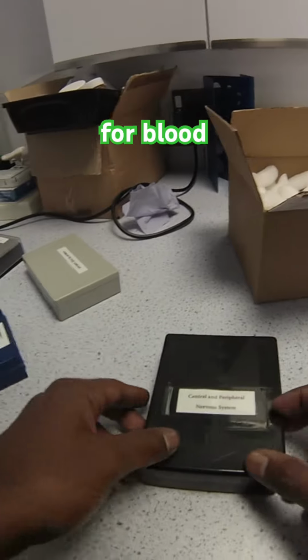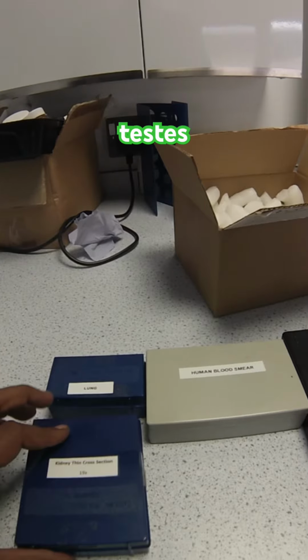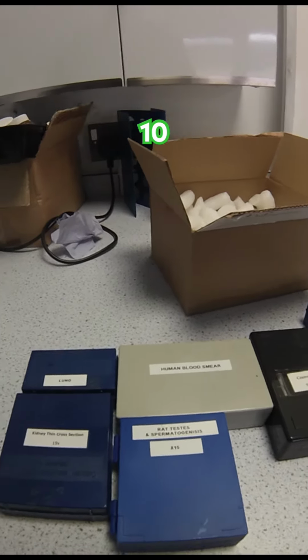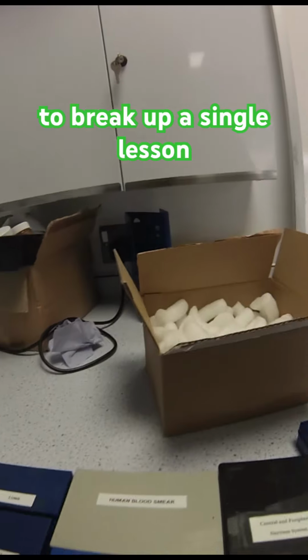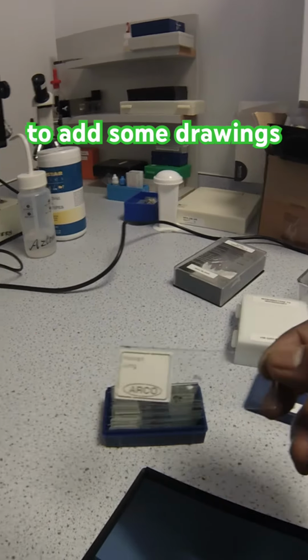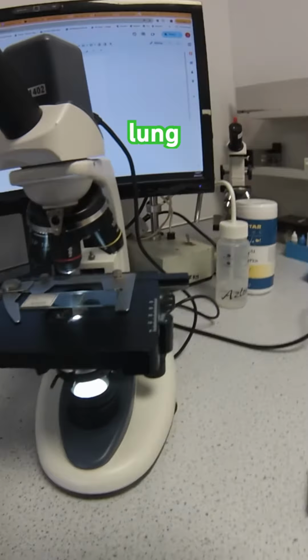I've got sets for blood, lung tissue, nervous system, specialised cells, botany, testes, heart tissues, root hair cells. It can be a really nice short 10-15 minute activity to break up a single lesson, or even a longer activity if you wanted to add some drawings and estimate cell sizes. So I'll just quickly show you how we walk through lung tissue.